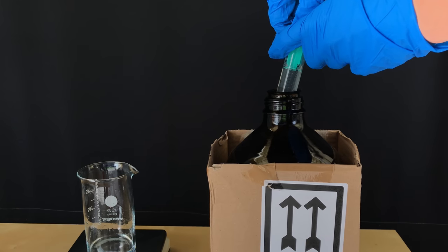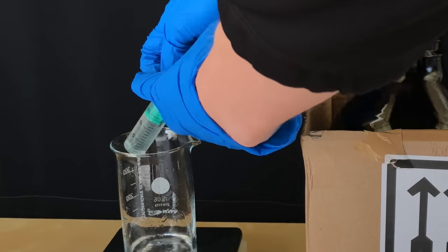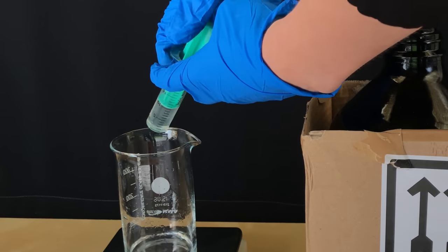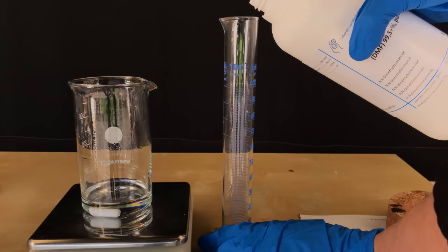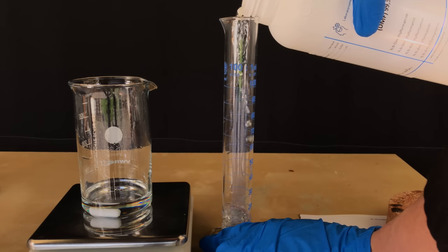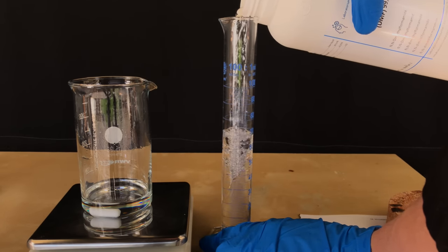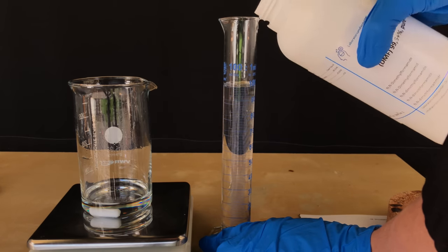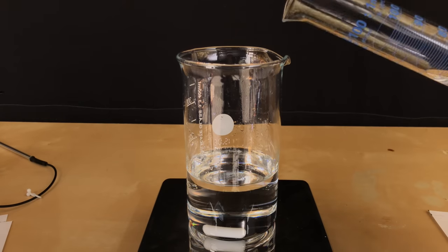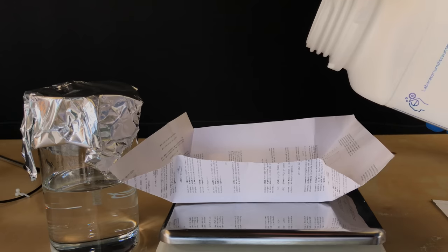To start off, we measured out about 40.2 ml of methyl phenyl acetate. This chemical is a nicely smelling liquid which has a grassy odor. It is also a great solvent for some plastics and it ruined one of my scales. Chemical number two is called DMF or dimethylformamide. It smells fishy, is slightly reprotoxic, and it will act as our solvent. During the isolation of our product, it is great that DMF can be removed using water due to its solubility in it.